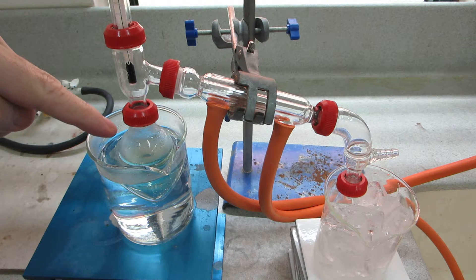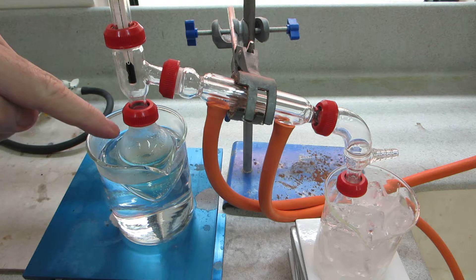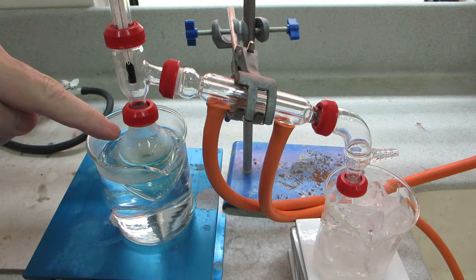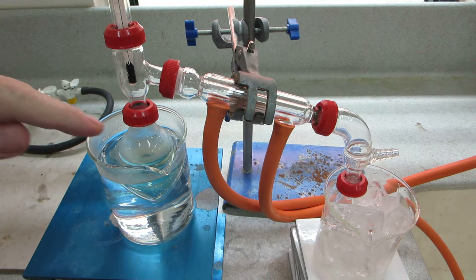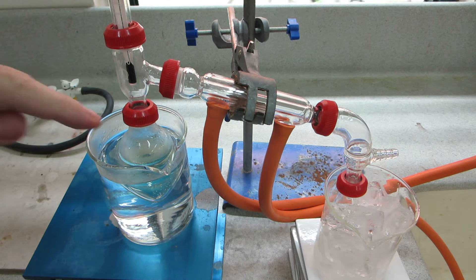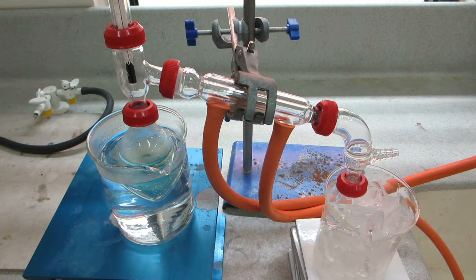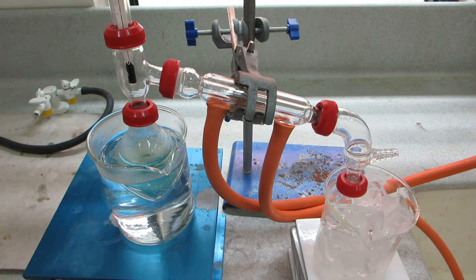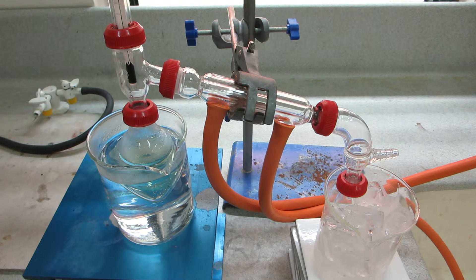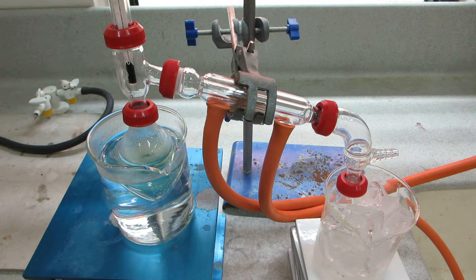Well, you may see some condensation appearing on the top of the pear-shaped flask here, and that indicates a volatile liquid in there. Of course, we've got ethanol in there. The temperature on the thermometer at the moment is reading 25 degrees centigrade.